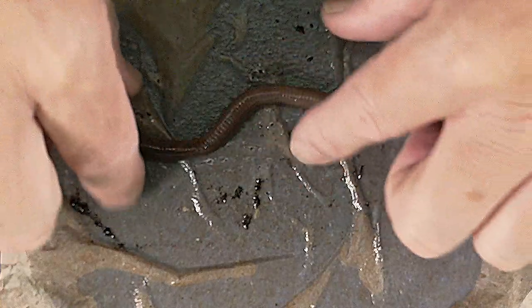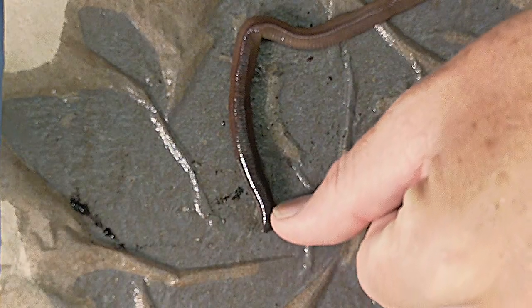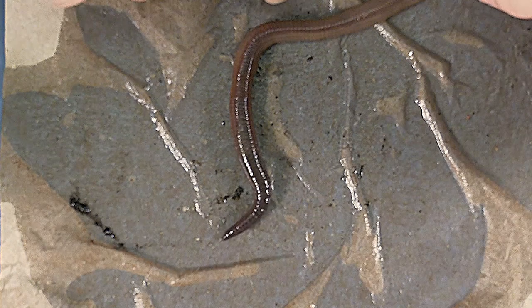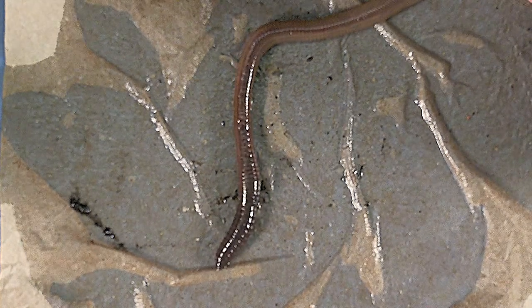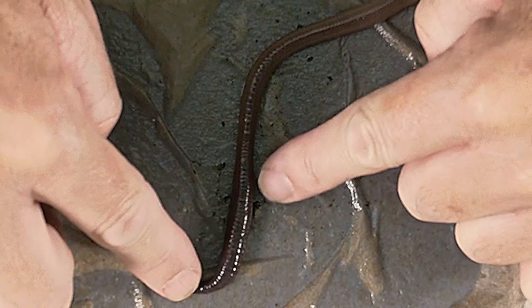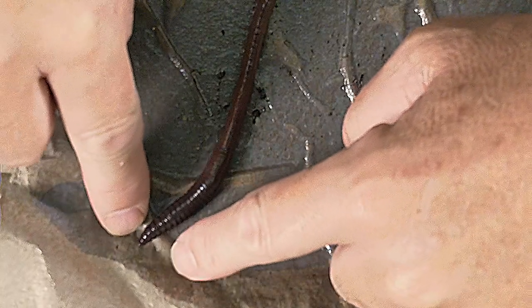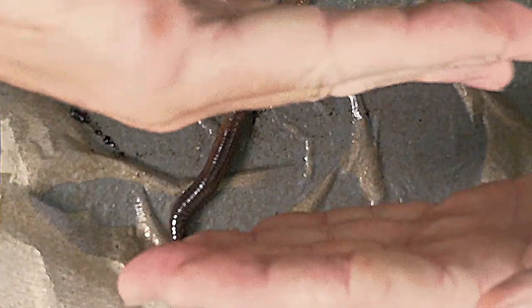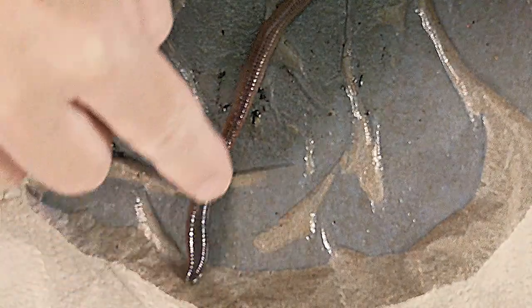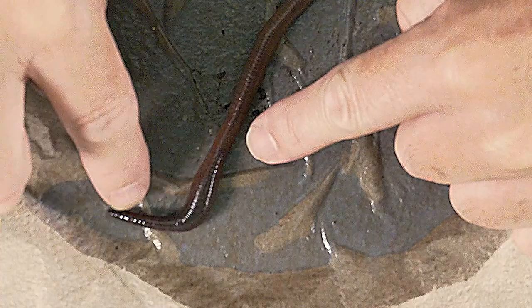Notice the segmentation on the worm — its body is divided into these segments, and each segment is internally very similar to its neighboring segment. The segments along the posterior end of the animal are virtually identical to each other internally. But in this anterior part there is internal specialization we'll see after the dissection. Internally, segments are separated from each other by a very thin membrane called a septum, which we have to break through during dissection.